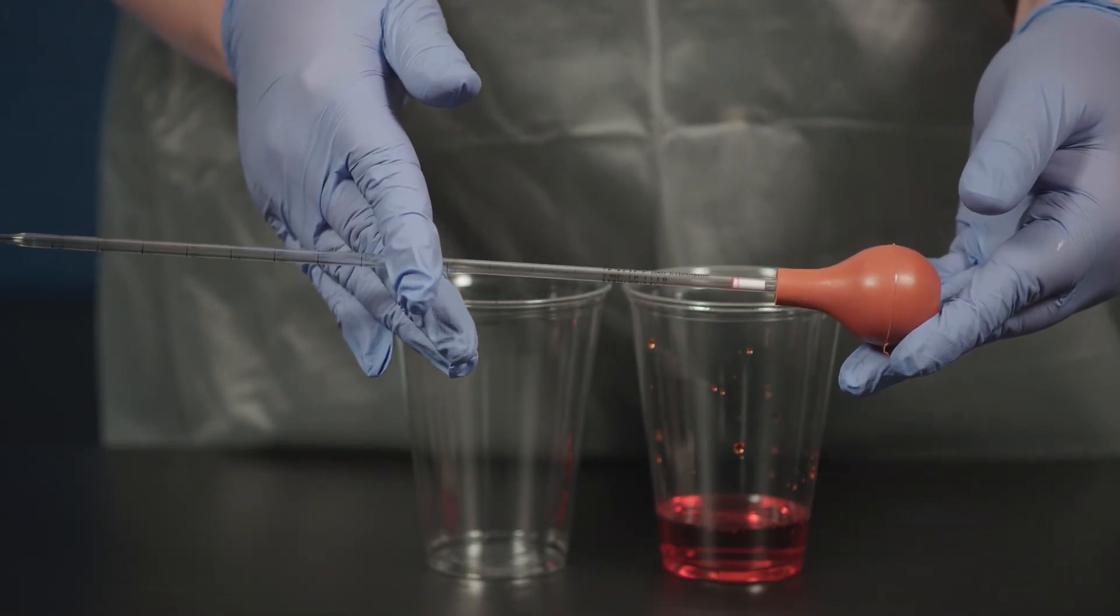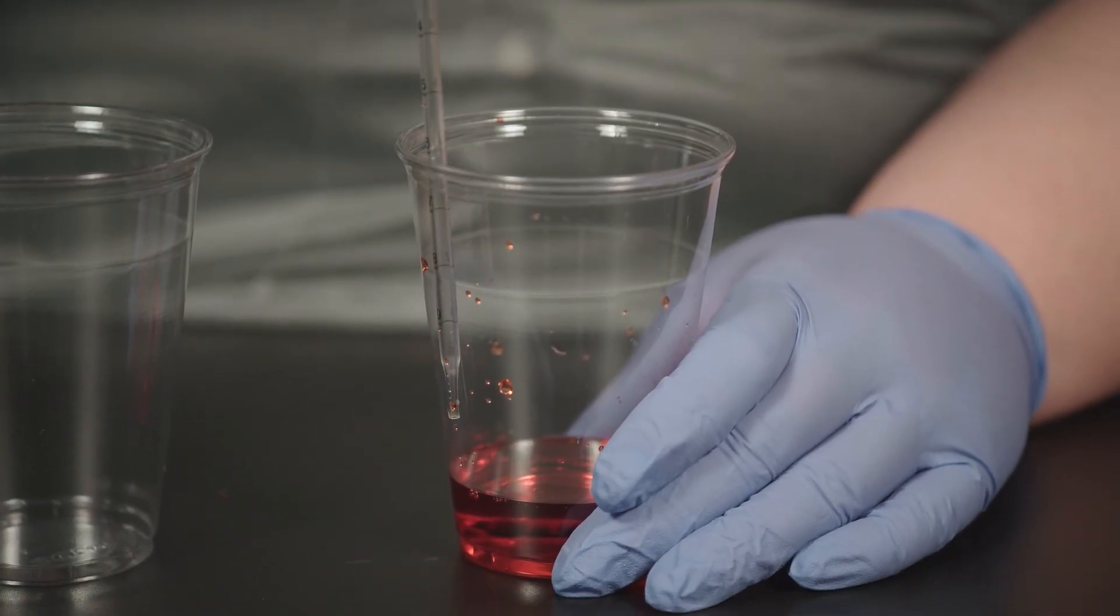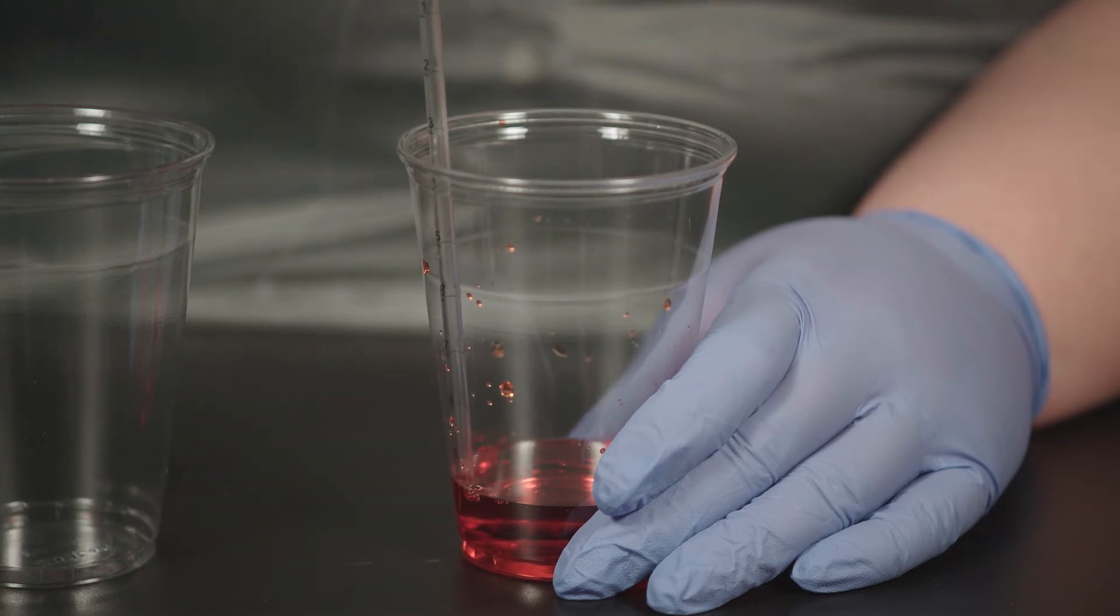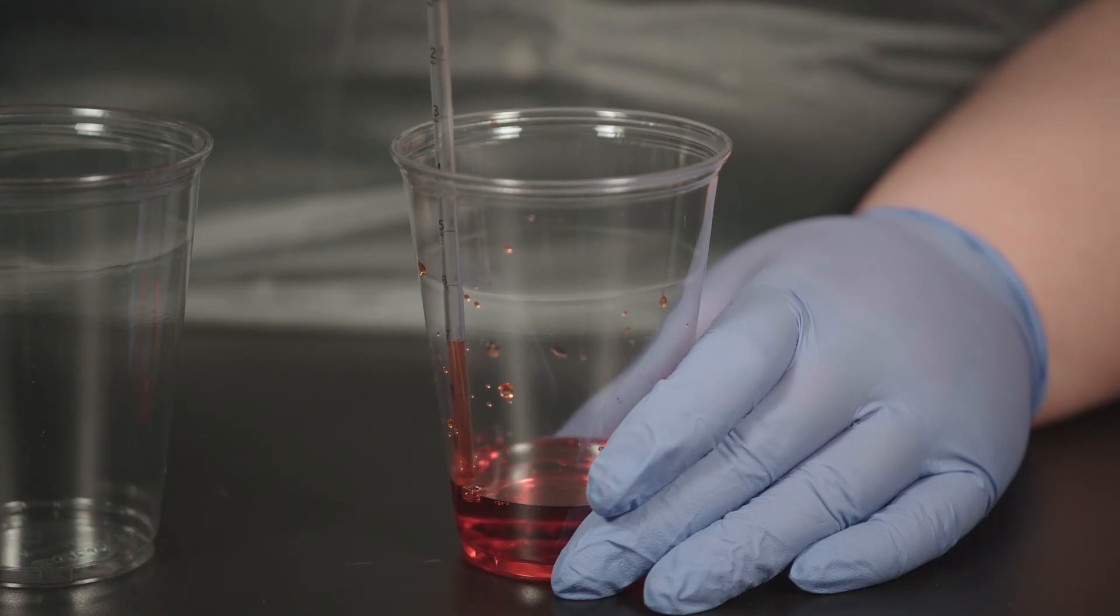For this demonstration, I'm going to transfer some water with food coloring so it will be easy to see. You may need to take special precautions depending on what you are transferring, so be sure to read your lab manual and watch any related videos before starting your experiment.